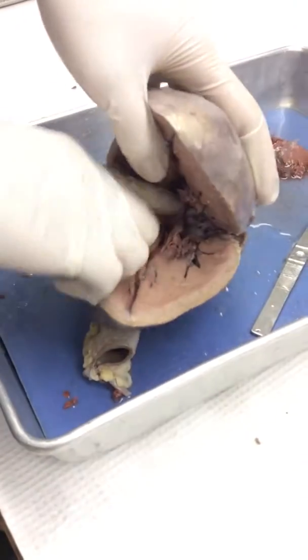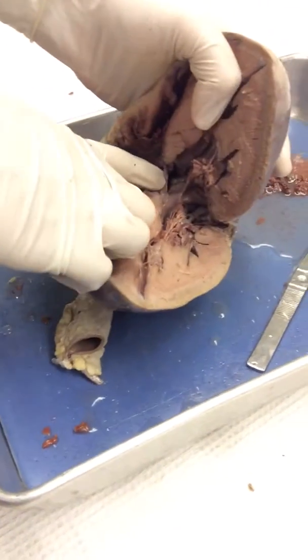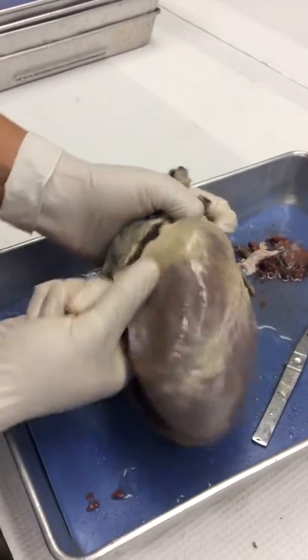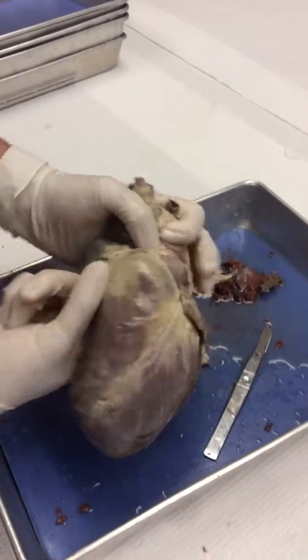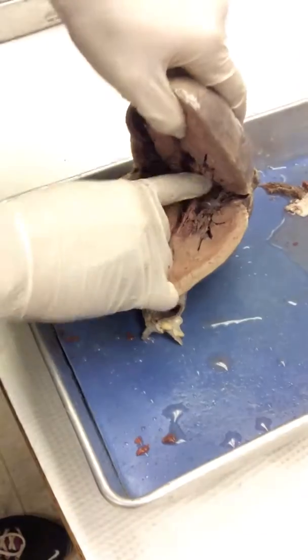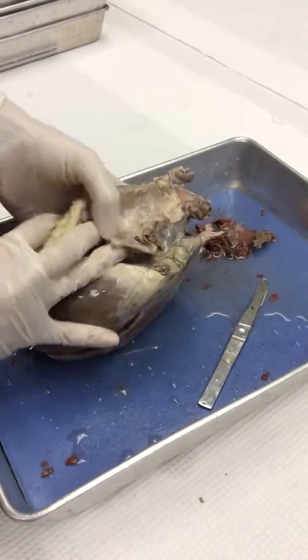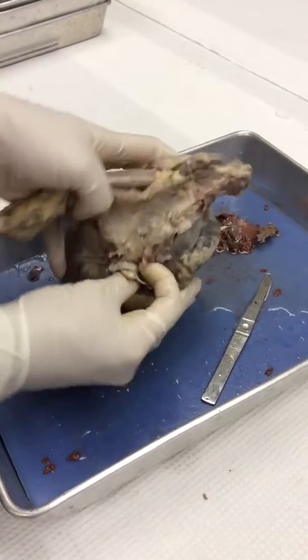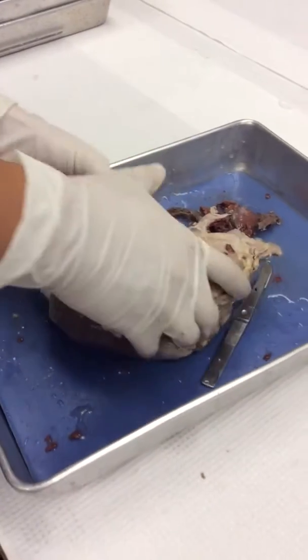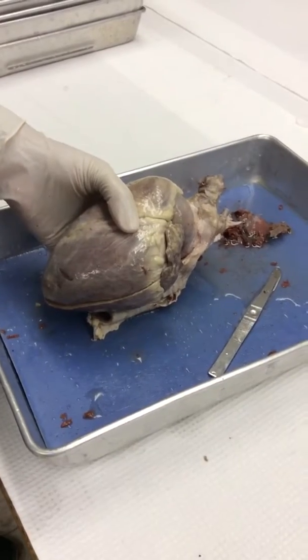And then from there it flows out of the pulmonary trunk. If you see this hole right here, if you stick your finger through it, okay, now I'm in the pulmonary trunk. So right atrium, right ventricle, through the pulmonary trunk, through the pulmonary arteries, which, if you flip it, are kind of smushed, but they're on the side. So it goes through the pulmonary arteries to the lungs, picks up oxygen. So now it has oxygen and comes back to the heart.